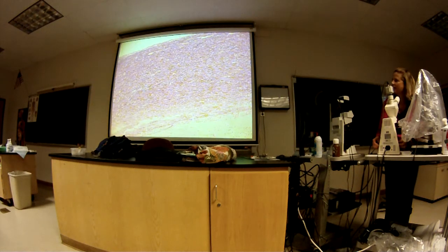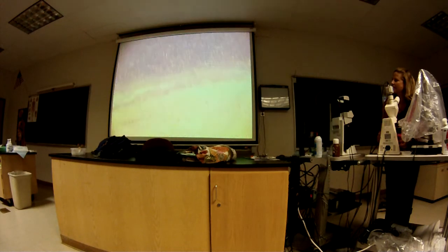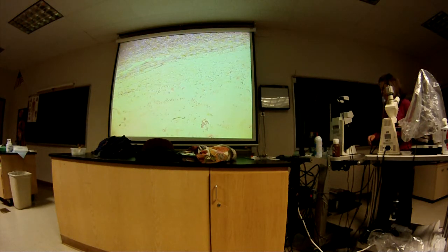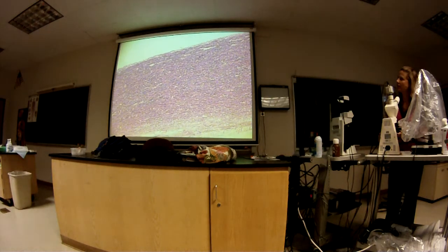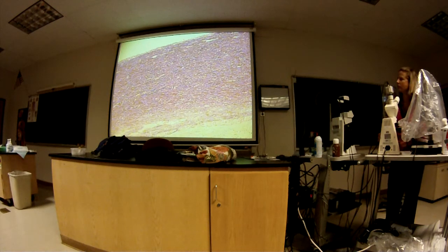So this one, what is this one here? Aorta. Yeah, that's the wall of the aorta. And so this is the externa out here. Yeah, the really light one. And so on this slide, this is the very thick media layer. And so the question could be, what are the black lines there? Elastic fibers? Yeah, elastic fibers.